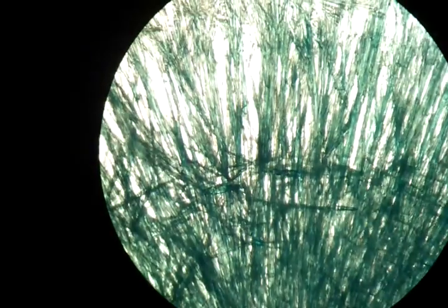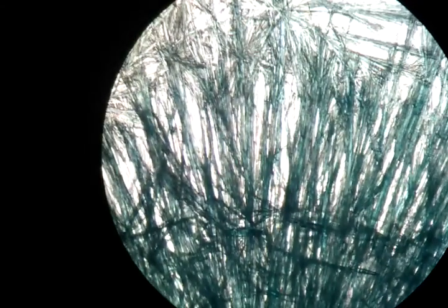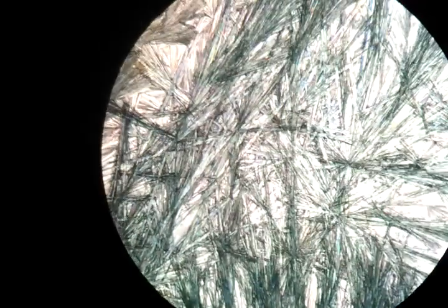This is how the center looks. It's kind of strange that here there's not the same kind of separation in the parts — here along this line, it seems to not really be there. A little more to the right, it's more open. There's an extra zone here, and this one goes to the crystallization part.